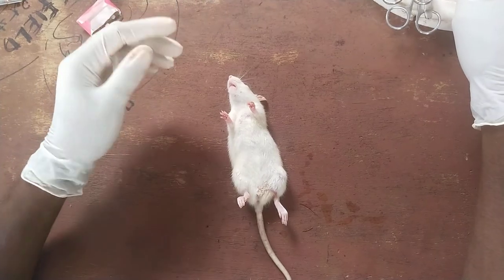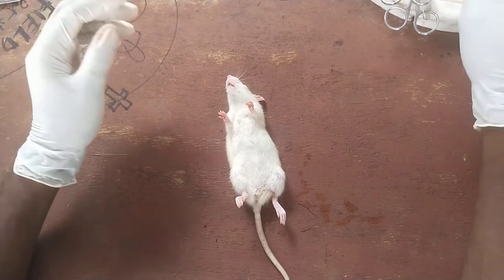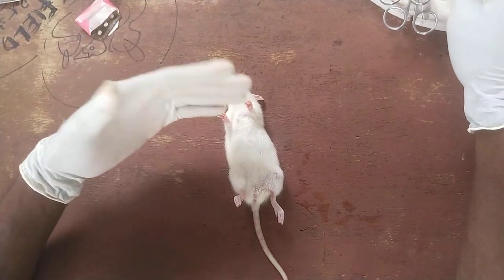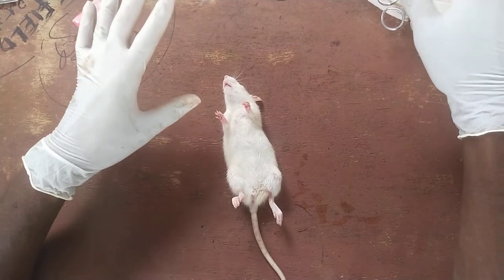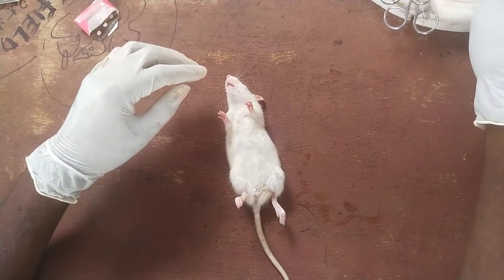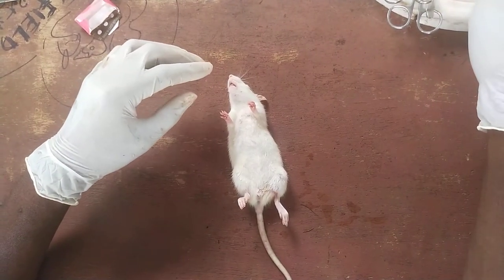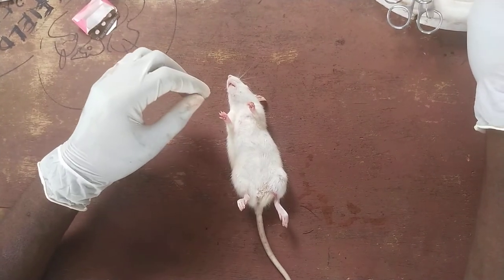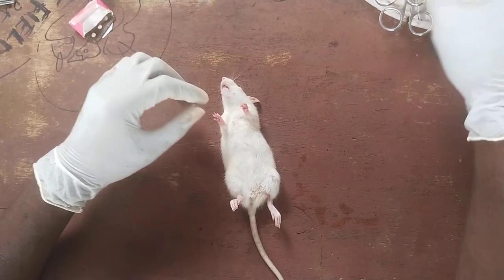We use an anesthetic agent — ketamine and xylazine — to make sure the animal is fully relaxed. Then you place the animal in dorsal recumbency, to make sure the back of the animal is placed on your surgical table.